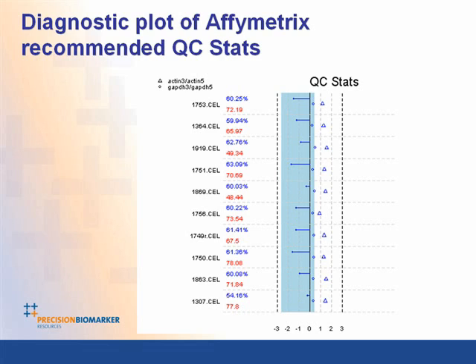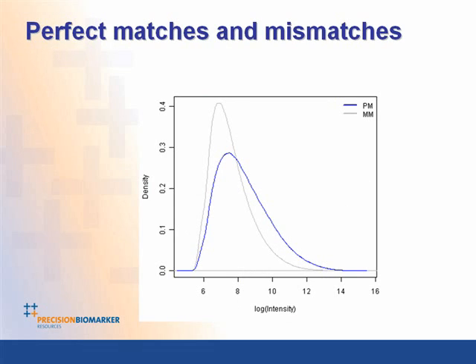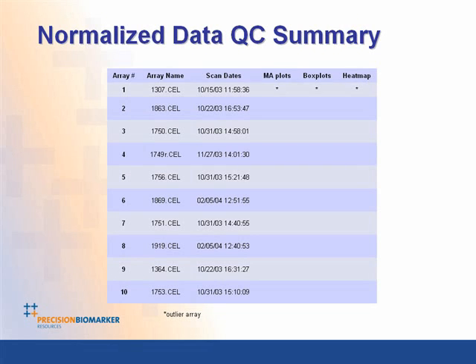Affymetrix QC stats, which are all very good, but you can see by looking at some of the between chip comparisons that some of those are much more sensitive to detection of outliers than the basic Affy QC stats. We also provide a separation of the perfect match and mismatches, looking at their overall intensities. Now, this data was then normalized using RMA.